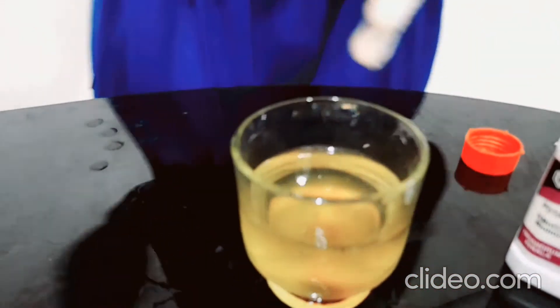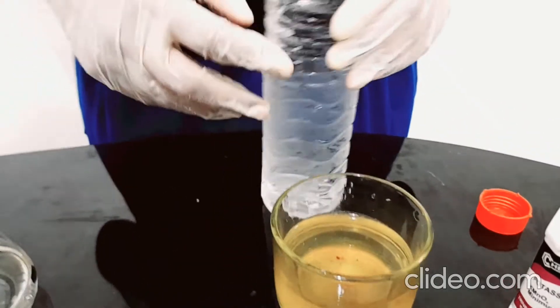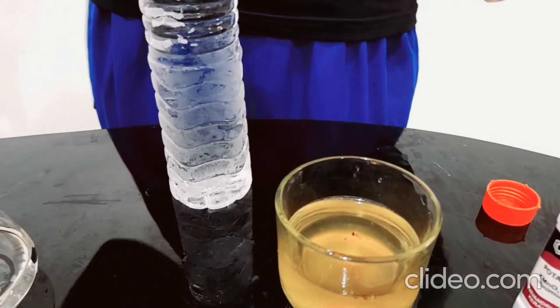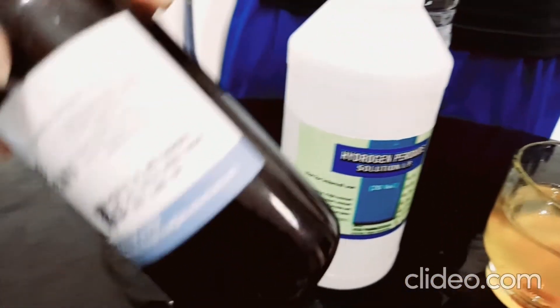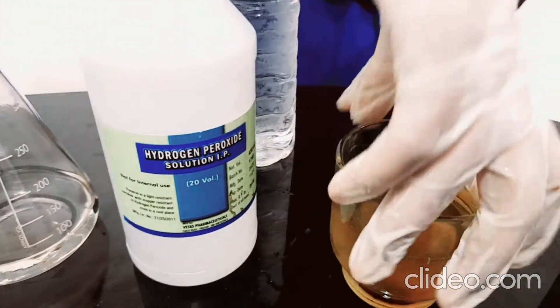This decolorization reaction is a success — let's go on to the next one. For the next experiment we need the special ingredient vinegar, and we need hydrogen peroxide which is H2O2, and we need iodine solution. I bought this from the store and this is completely concentrated.